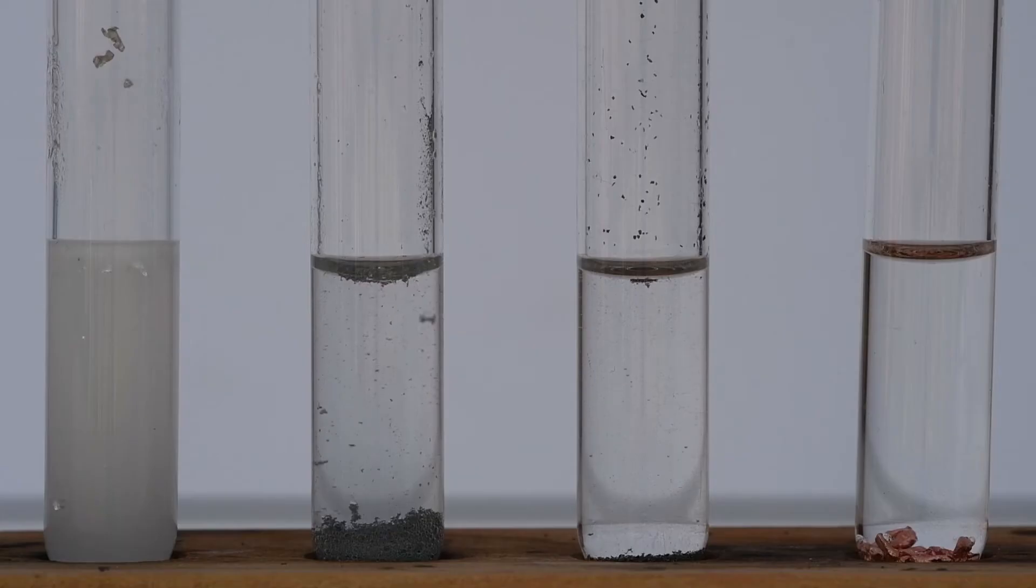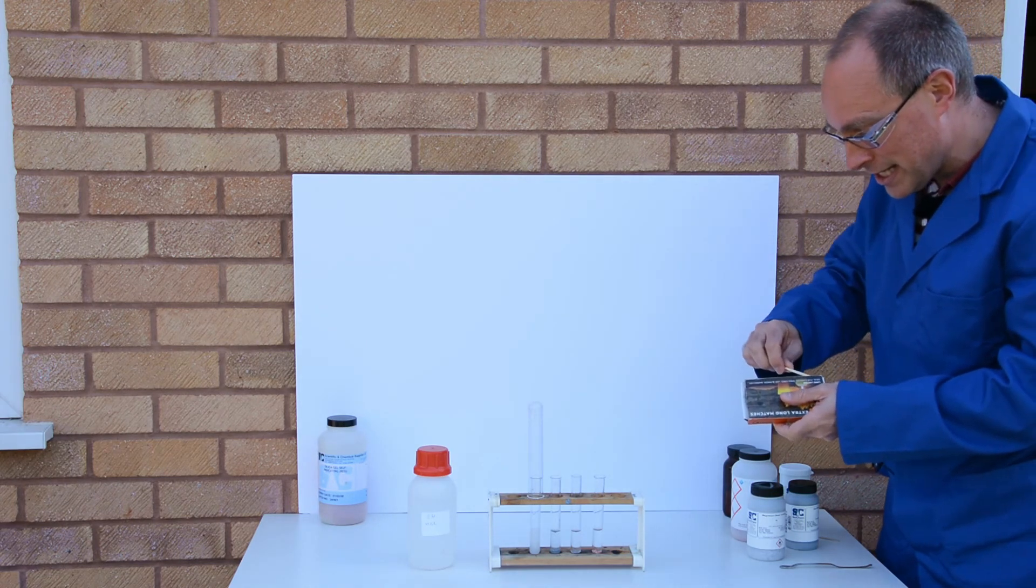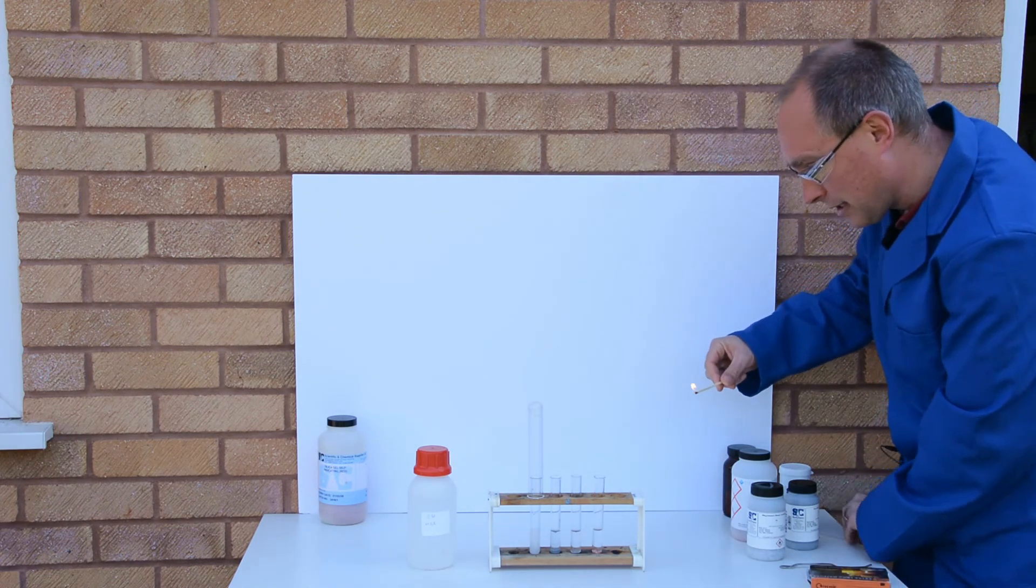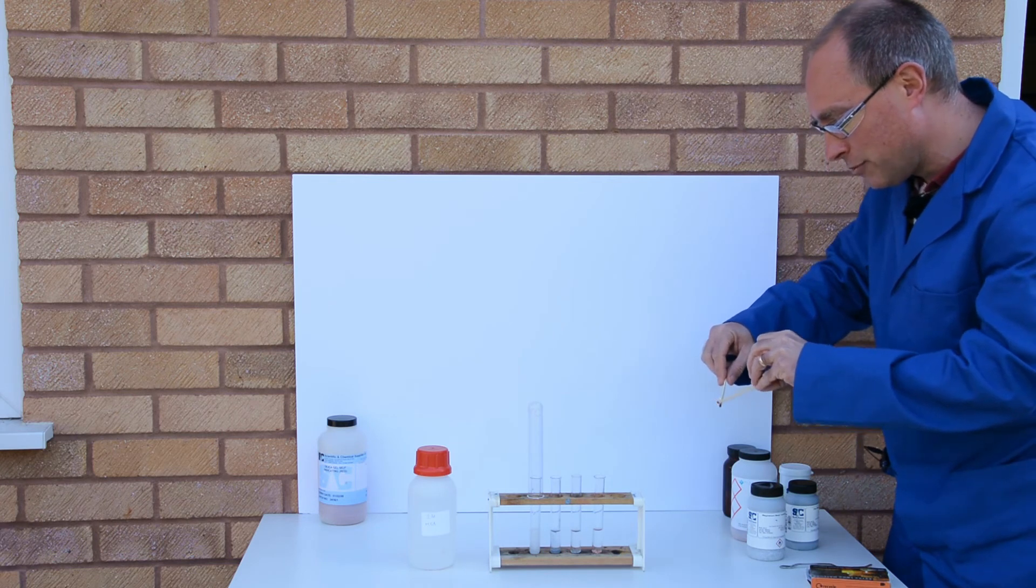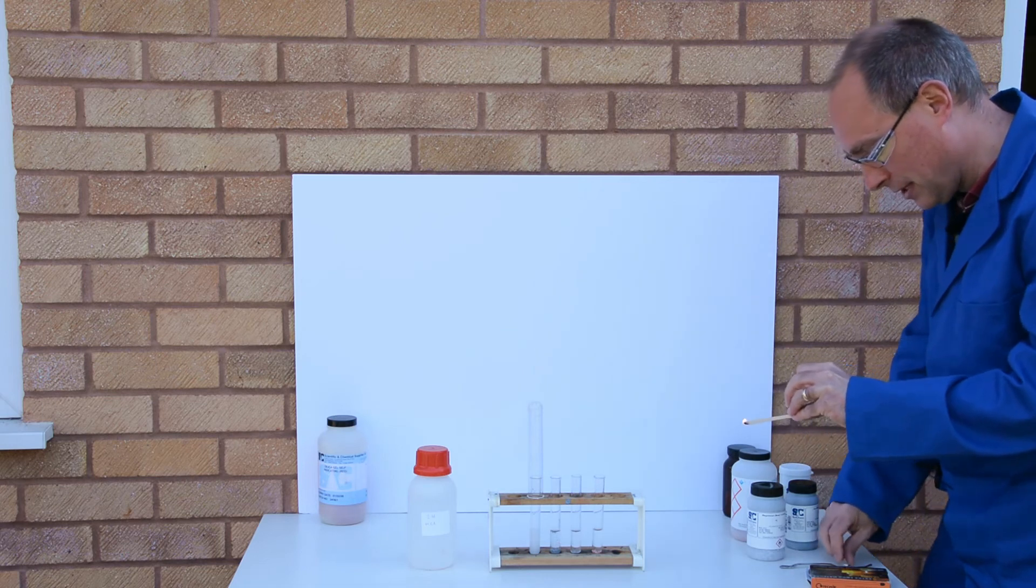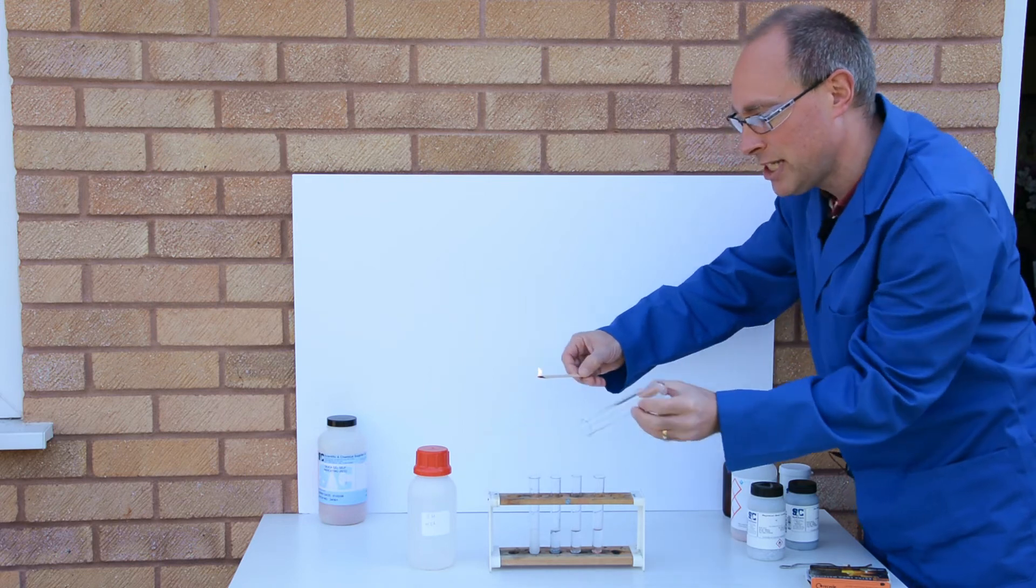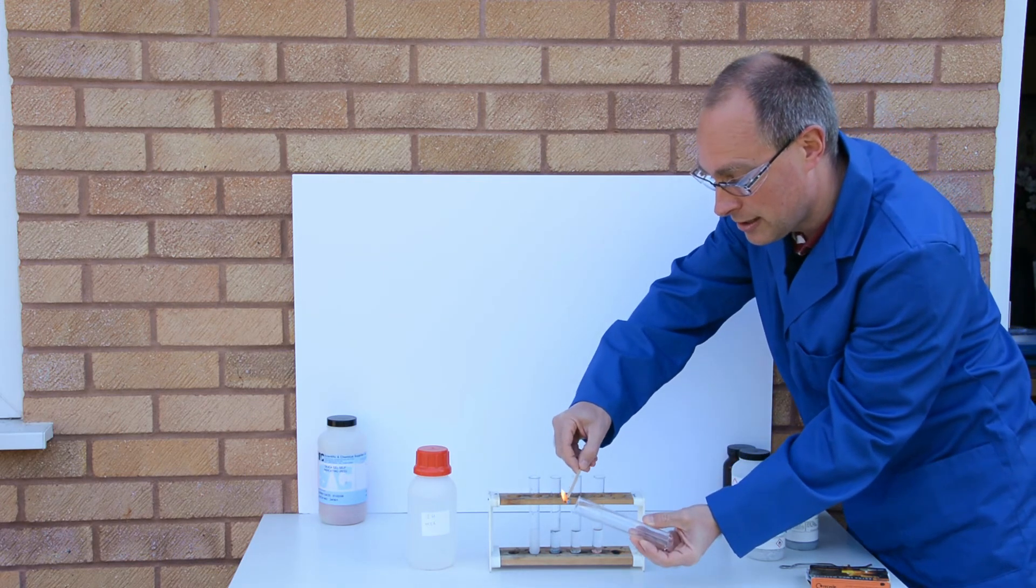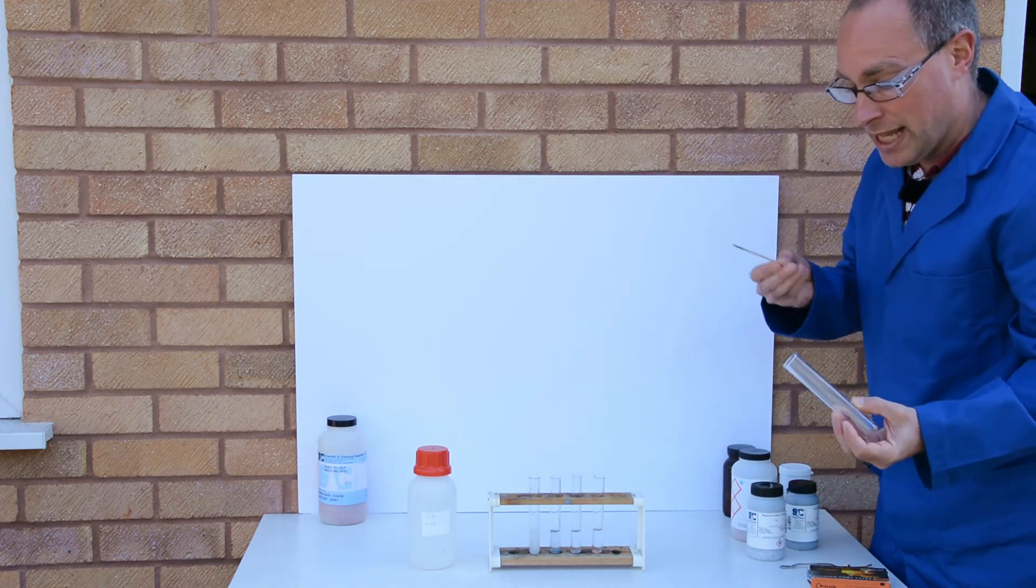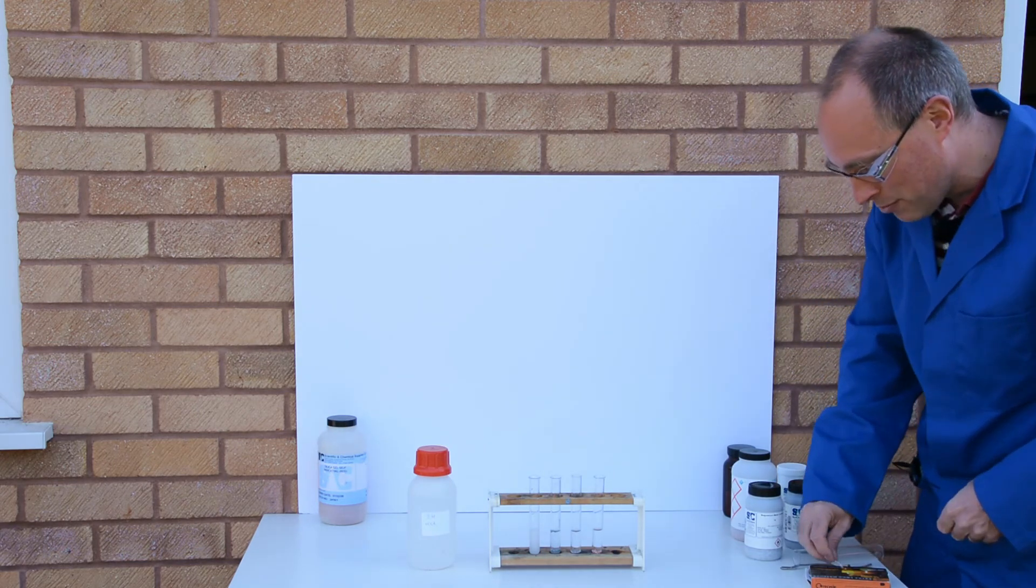The gas is going to be hydrogen, and so to test that hydrogen I'm just going to take the gas which I've collected in the boiling tube there and we'll test it with a lit splint, and definitely a positive result there for hydrogen with that squeaky pop.